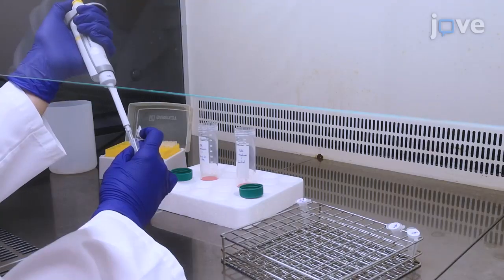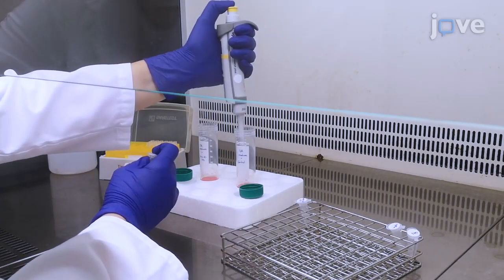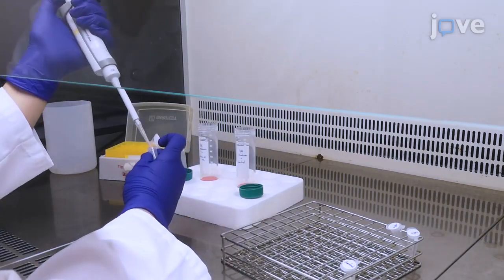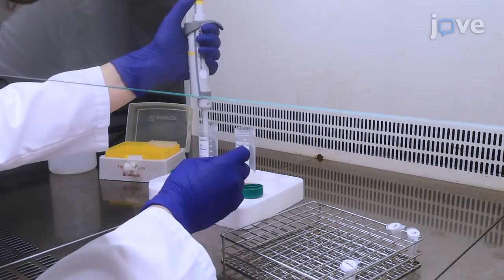This simple protocol allows one to label EVs and monitor them via confocal microscopy. For instance, EV imaging might help in evaluating EV distribution when used in therapeutics. This technique allows one to monitor EV migration and uptake in cartilage explants easily, with confocal microscopy without any special function. The same protocol can be used for EVs for in vitro or in vivo experiments.